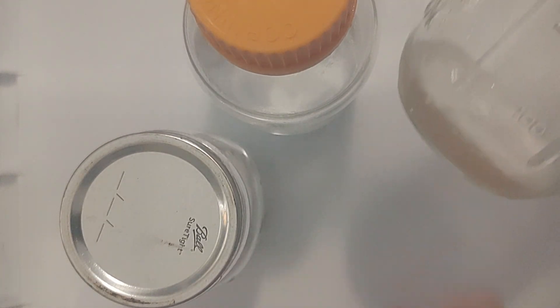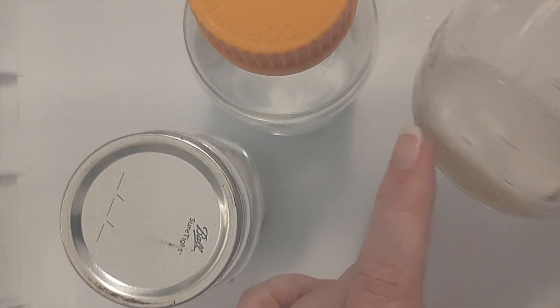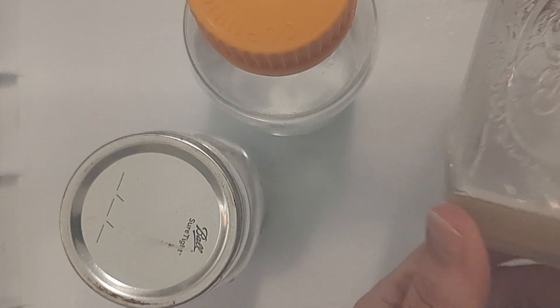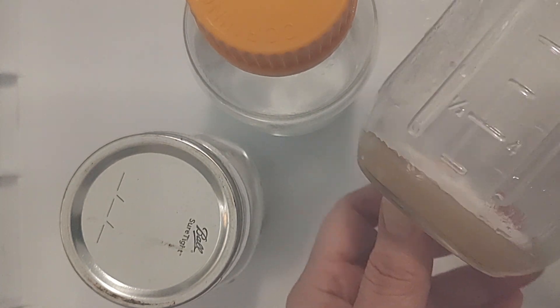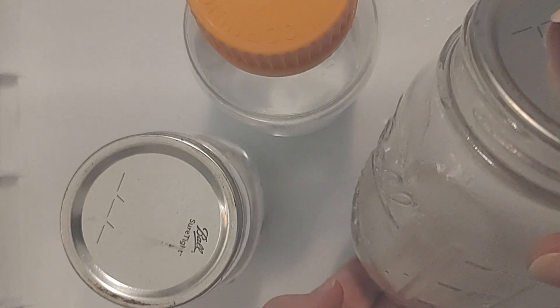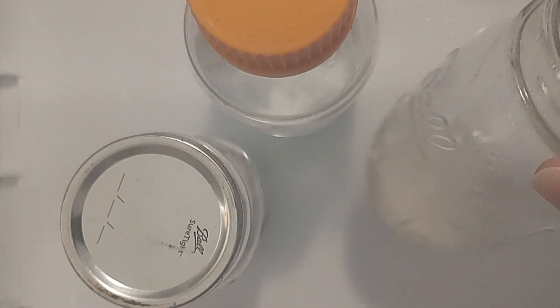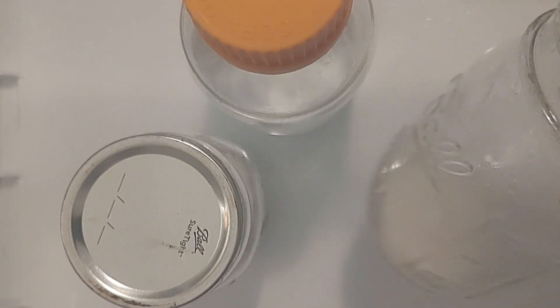What we did was put in a transfer from an agar plate in the middle and it grew out all the way to the sides — you can see all the way out. It looks gorgeous. What we're going to do is pour in 100 milliliters of water and then create this slurry by stirring it around and mixing it around.